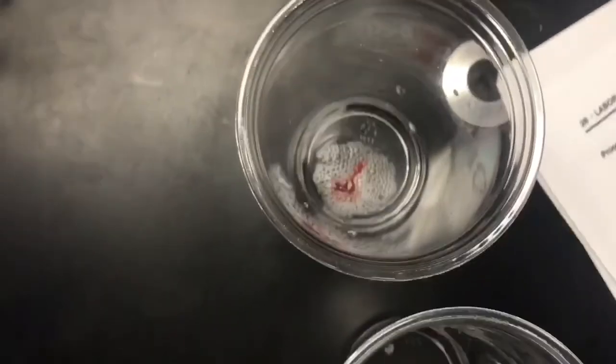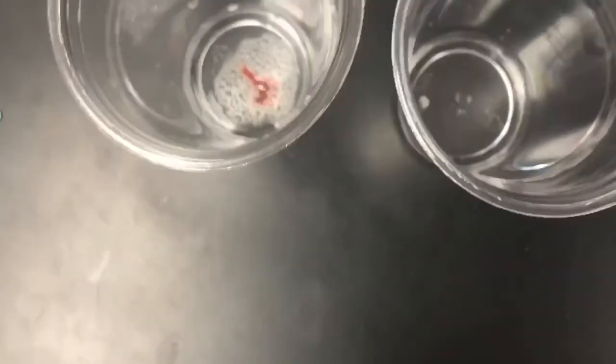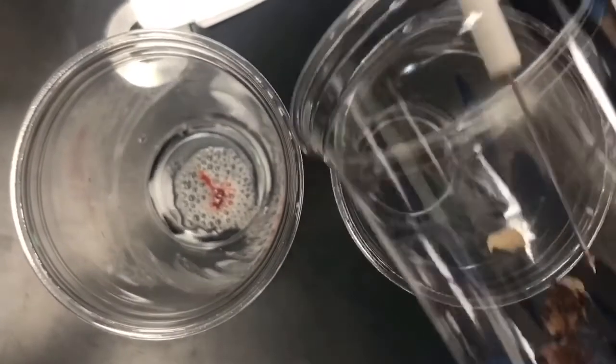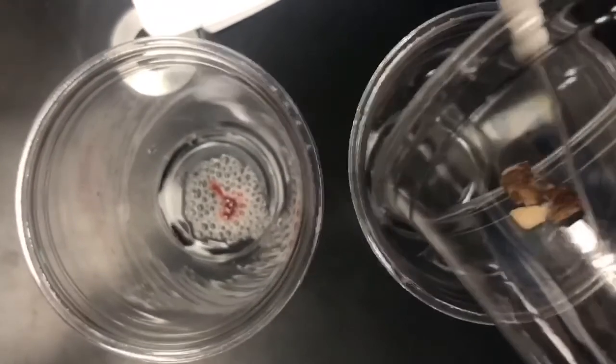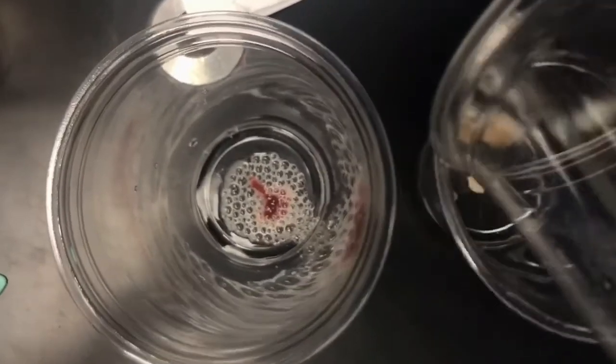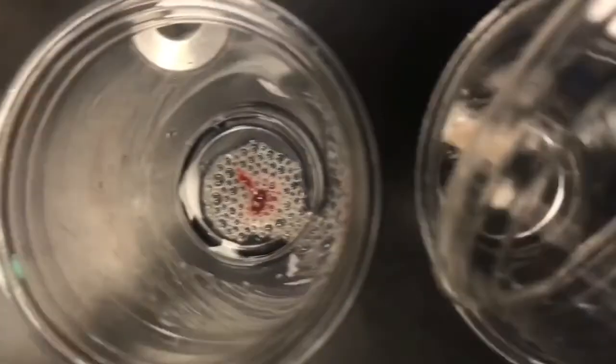For the third part of our lab, we also put 10 milliliters of hydrogen peroxide into 2 separate plastic cups and cut 1 centimeter of liver and potato. We macerated the liver and potato. We then put both into the separate cups of hydrogen peroxide. Both cups started to bubble. However, when liver and potato are macerated, then boiled, and then placed into the hydrogen peroxide, we notice that they don't bubble. This is because the enzyme is denatured.